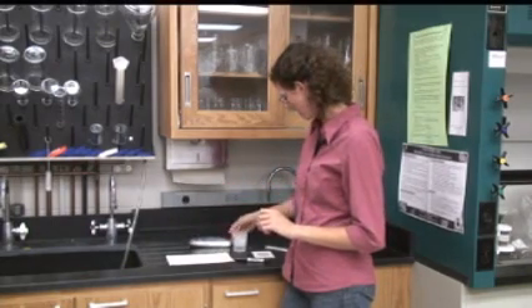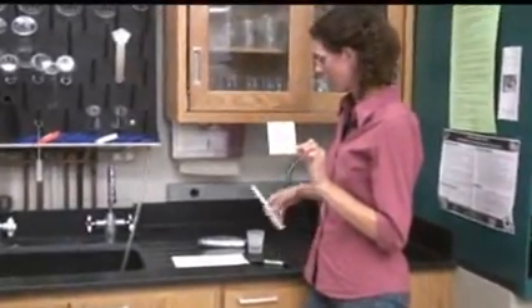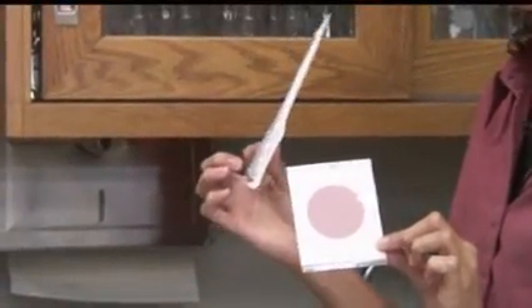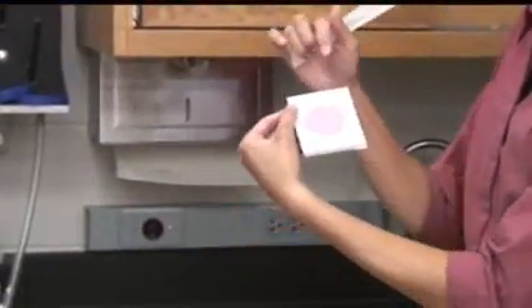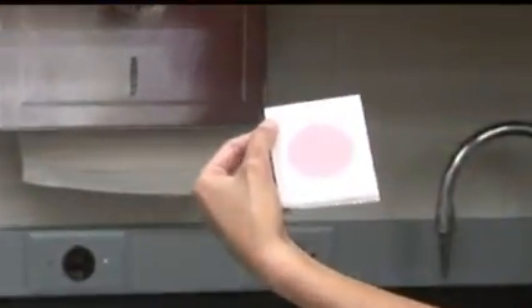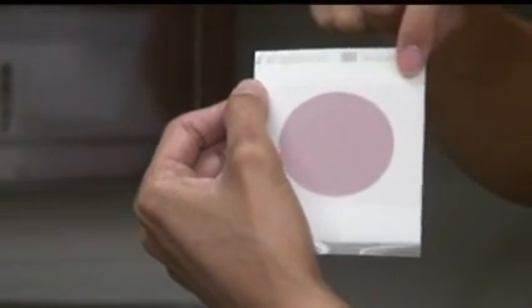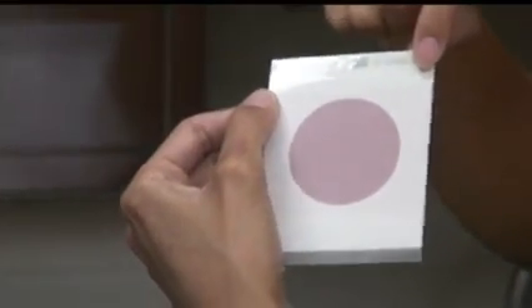In order to run this test, remove one of the plates from the bag and have a sterile pipette to pipette one milliliter of your water onto the plate. Before you put your sample on the plate, label it across the top using a ballpoint pen or a permanent marker with where the sample is from and the date that you do the test, in order to keep track of how many days to wait before reading it.